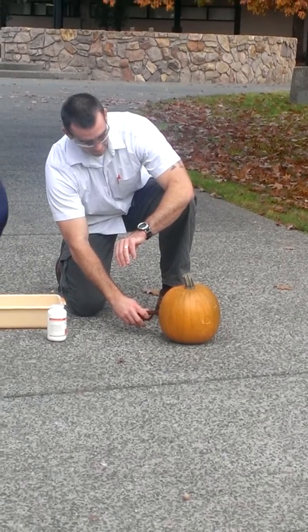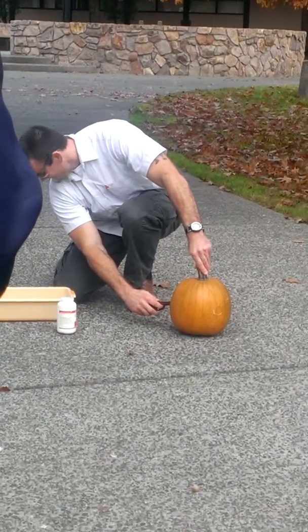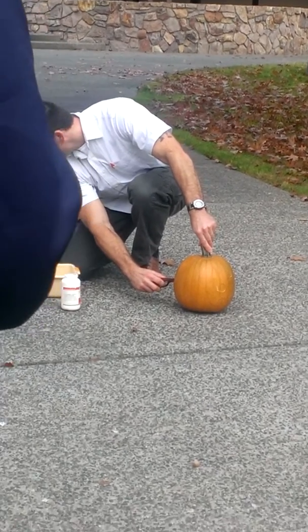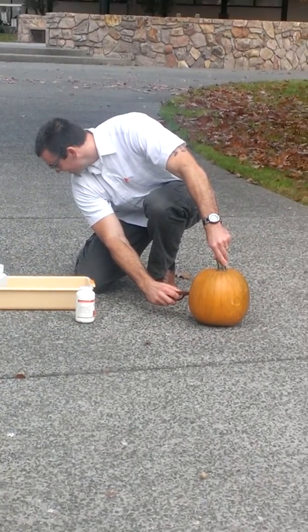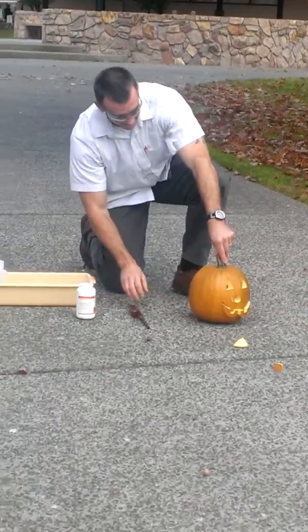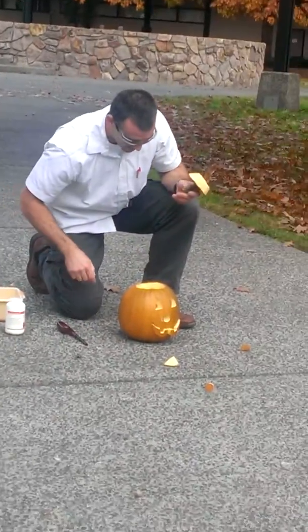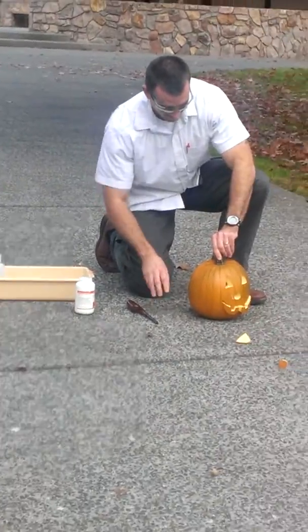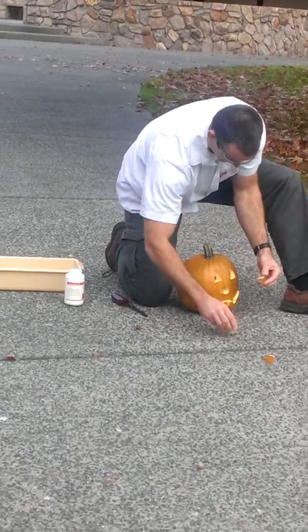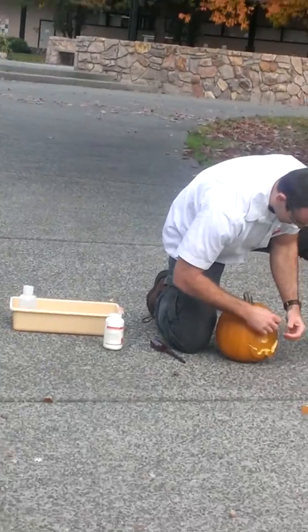Okay, give me a countdown from 10. 10, 9, 8, 7, 6, 5, 4, 3, 2, 1. Oh! Oh, man! Maybe I do not understand it. 20? Here, we'll let it go for a little bit longer then. That was amazing. I don't understand the nature of chemistry.